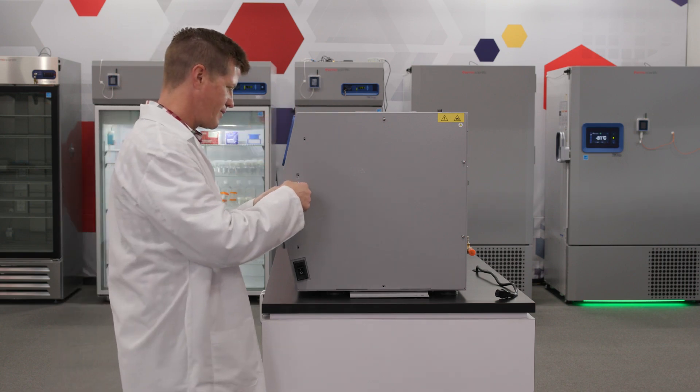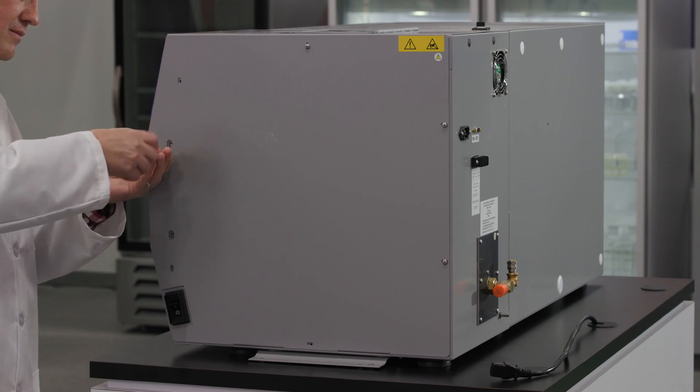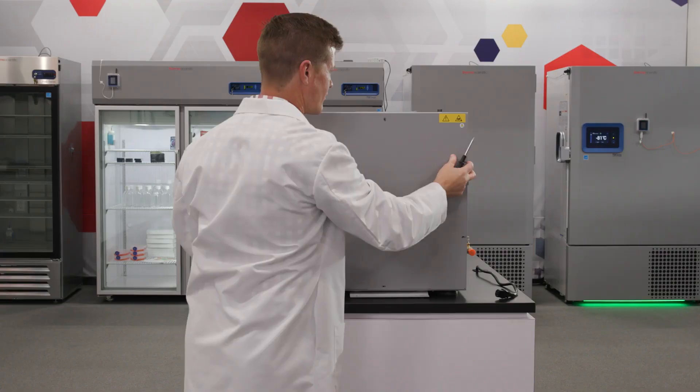In order to replace the battery, adhere to the following steps. Locate and remove the service panel on the right side of the CryoMed by removing the screws around the exterior of the panel.